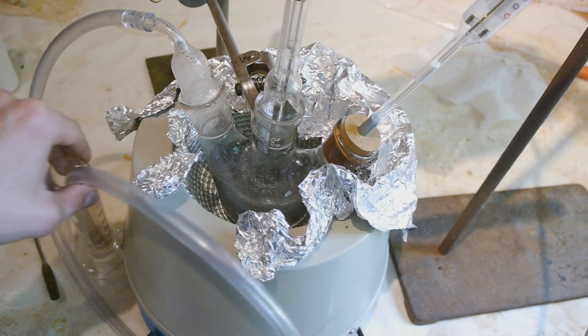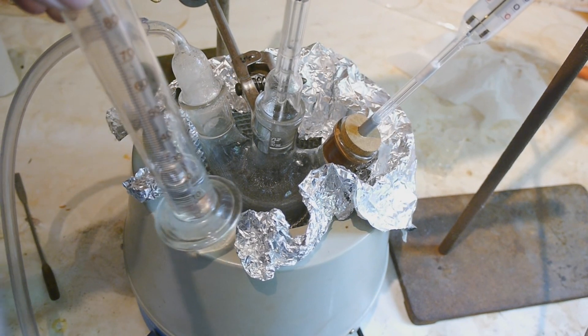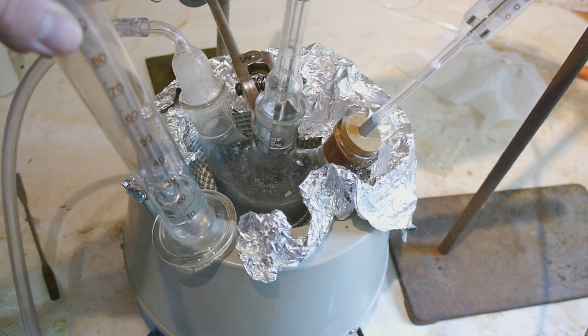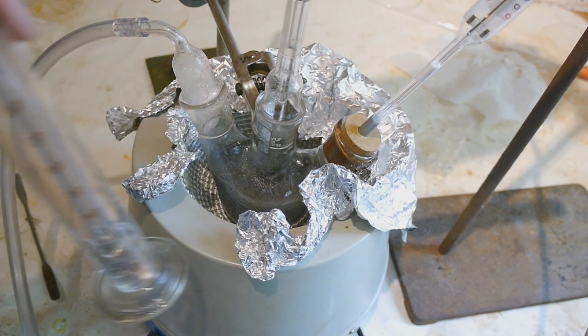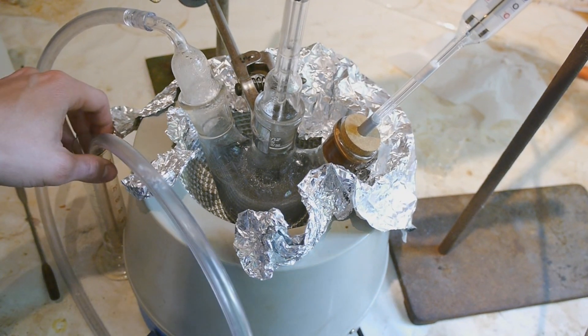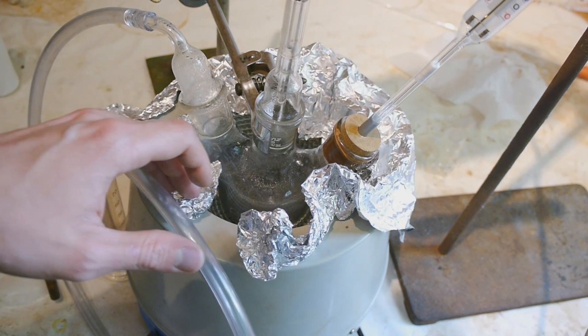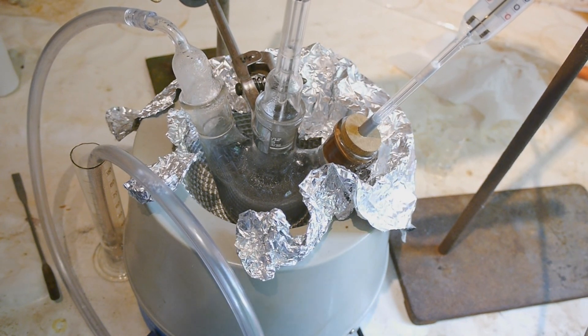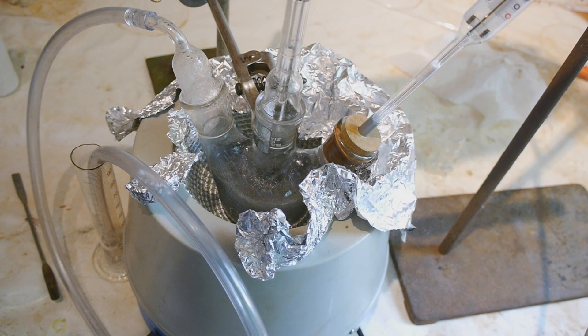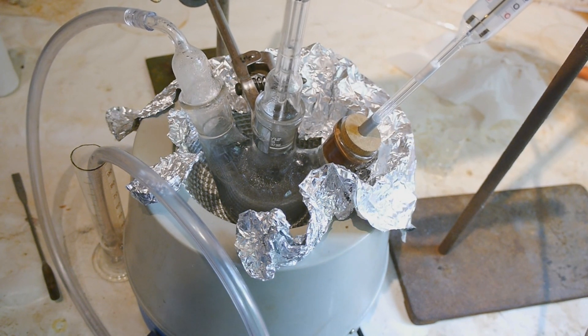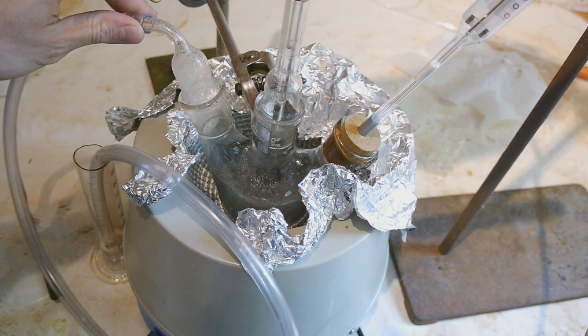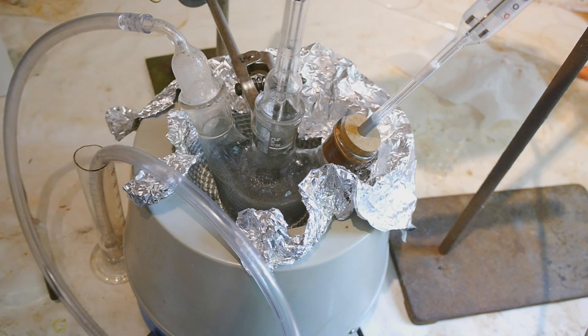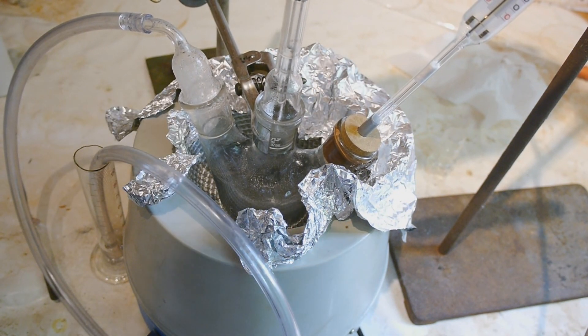Okay so 6 hours later the reaction appears to be already done. So we are getting a slight suck back in the bubbler already. I'm really hoping that this is because I've used less solvent which increased the concentration and therefore the reaction speed, and not that we have another problem. But I just let it run overnight and then we'll see.